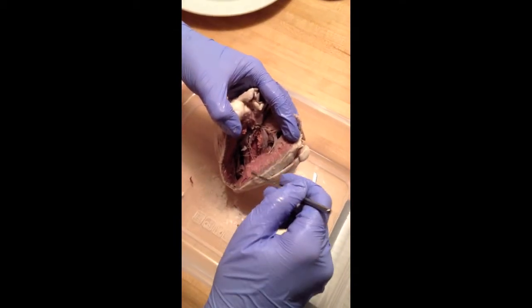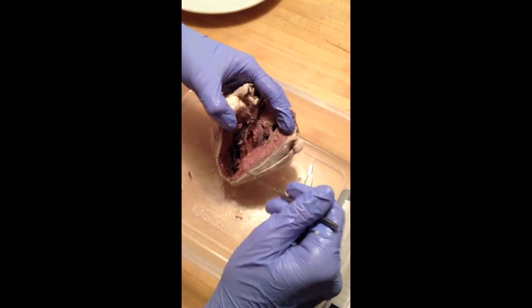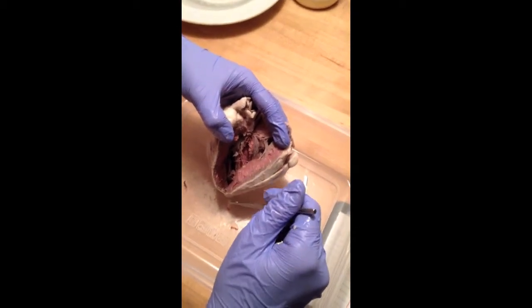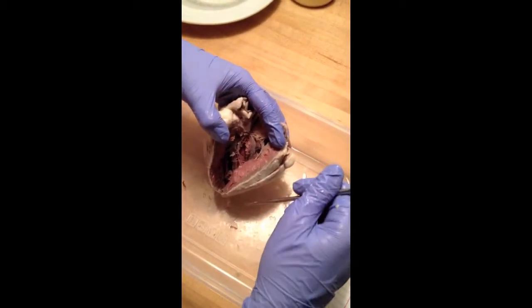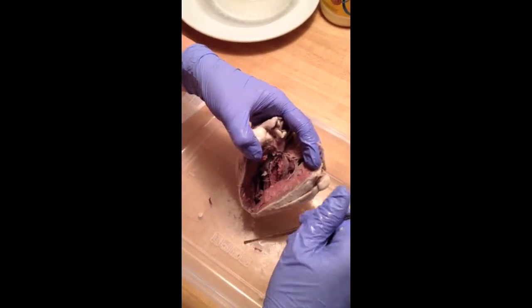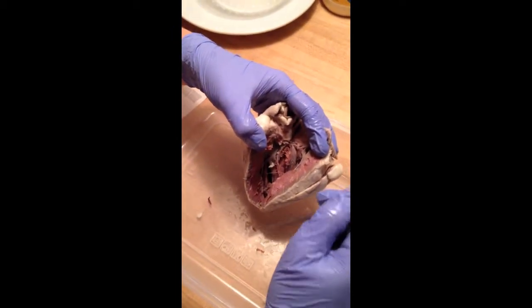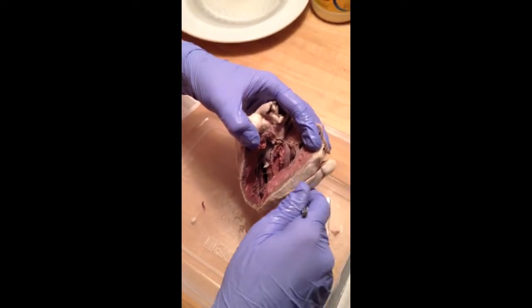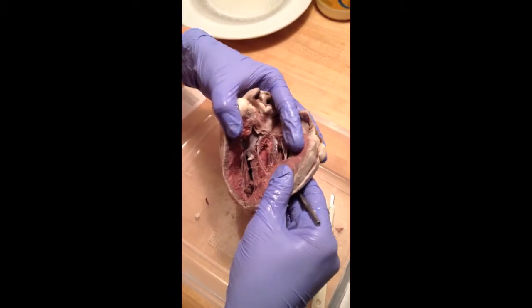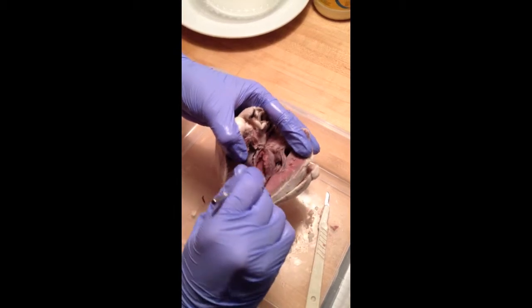The myocardium of the left ventricle is 3 times thicker than that of the right ventricle because the left ventricle is responsible for pumping the blood through the whole body, whereas the right ventricle is only responsible for pumping blood to the lungs. The trabeculae carneae on the inner surface of the ventricles is this fibrous tissue.